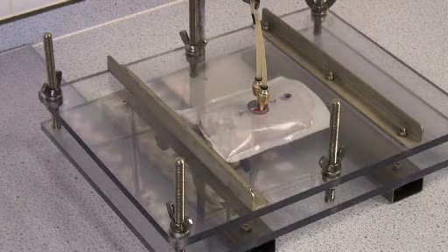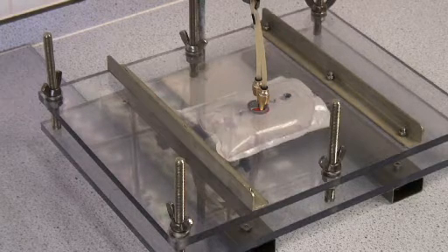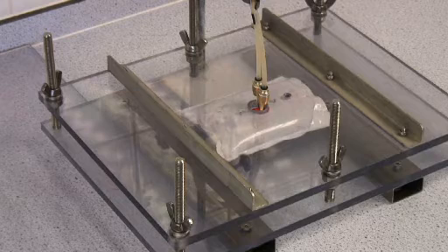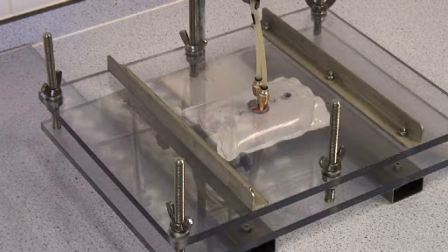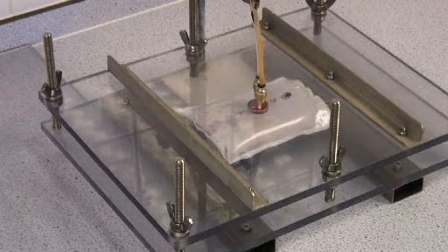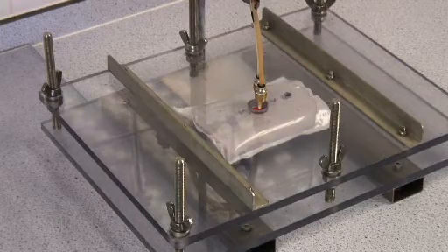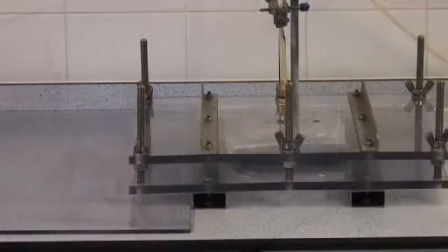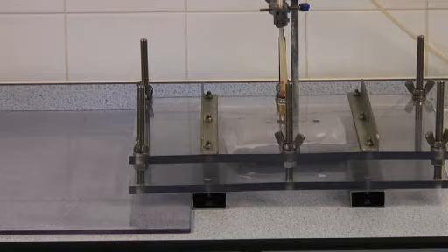As the pack inflates, the force acting on the upper and lower body of the pack are balanced by the reaction force exerted on the plates. The plates are there to maintain a constant angle and without these the pack would take a pillow shape and the seals would peel from the inside.